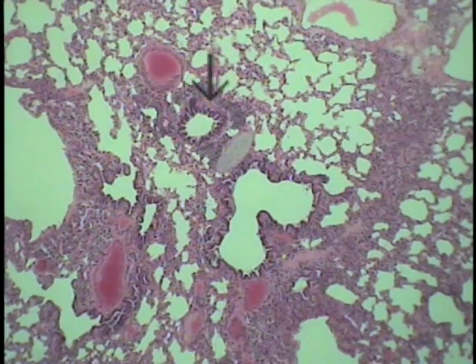The bronchial smooth muscle, of course, is prominent, and then you get a pretty elaborate folding of the mucous membrane, which is probably more simplified at this point, probably a ciliated columnar with a few remaining goblet cells within it. So we're looking down into the lumen as it is cut at this angle.